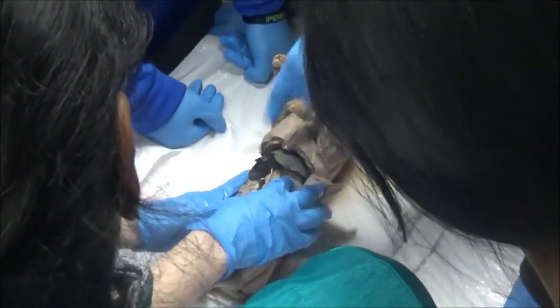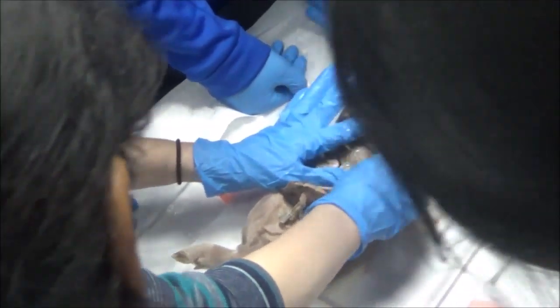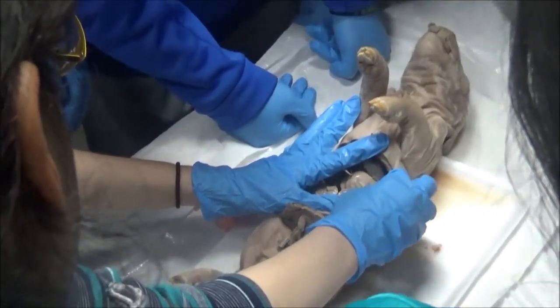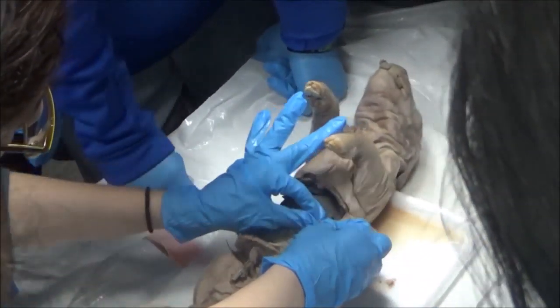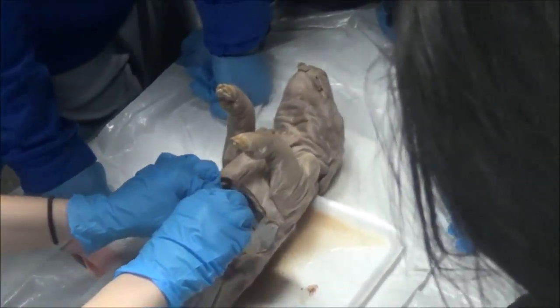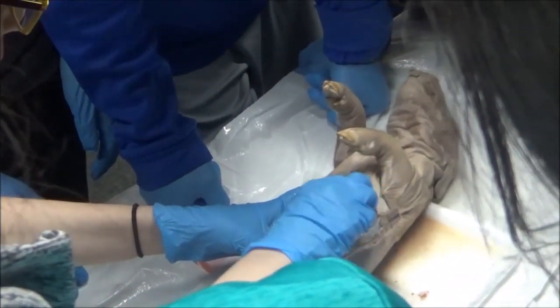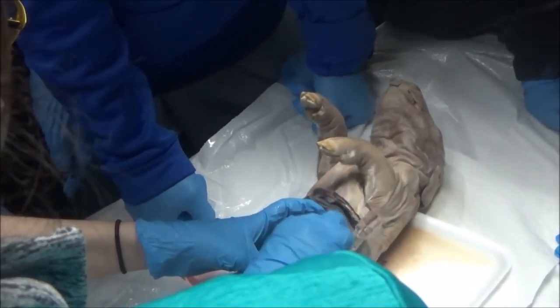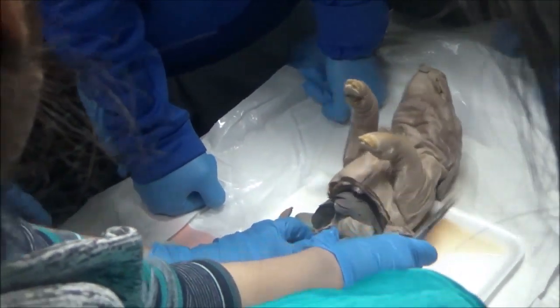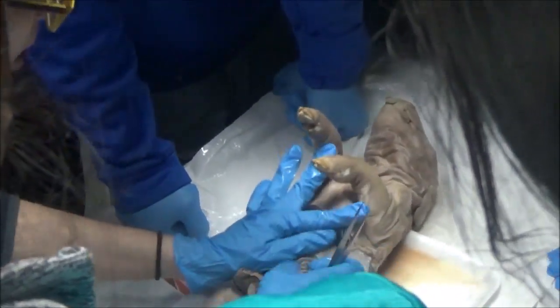And what's this tissue? It's connective stuff, it's nice and slippery. I can actually remove it off the stomach so you can have a better look. So what should the stomach be connected to? The esophagus and the small intestine. To find the esophagus, it looks like I have to dig really deep in here to see where it's connected — it's going to be going up to the throat.